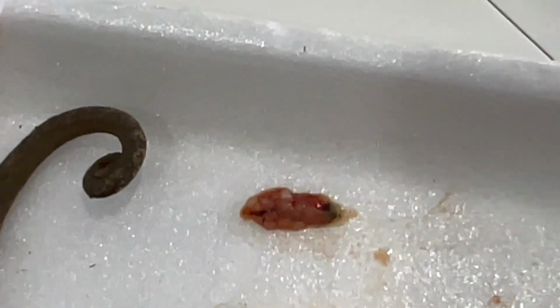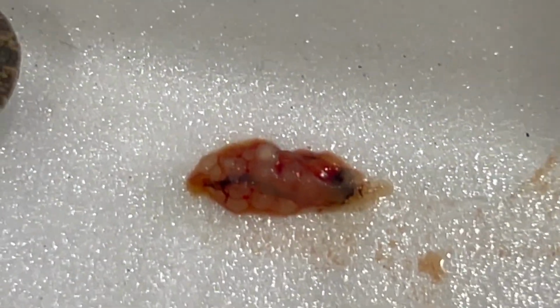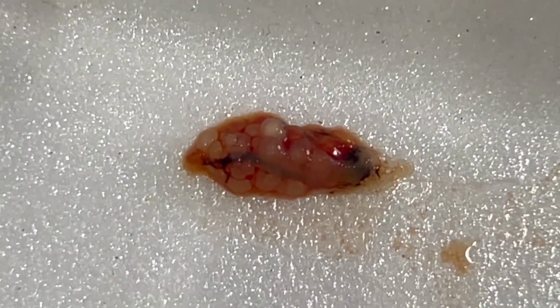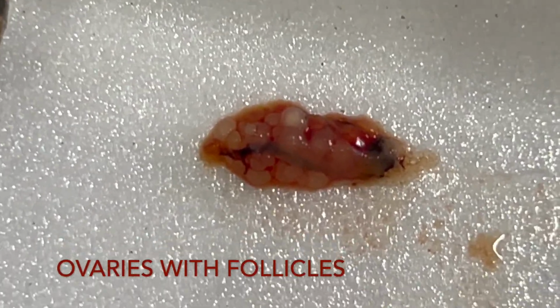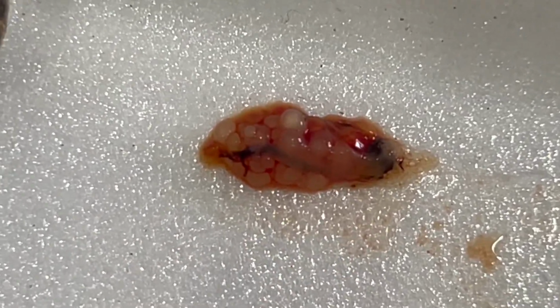Now let's go very quickly over the organs. These are the follicles for the next breeding season.